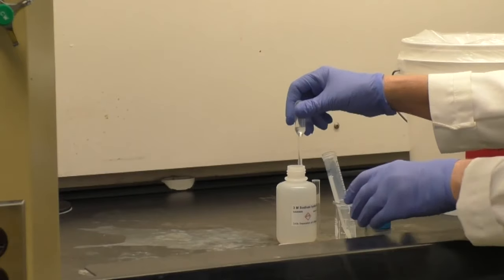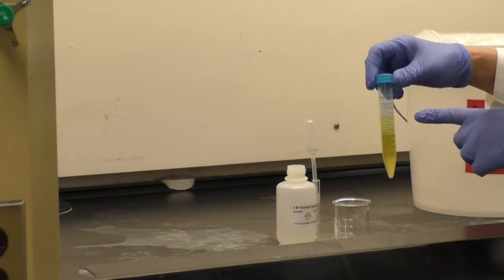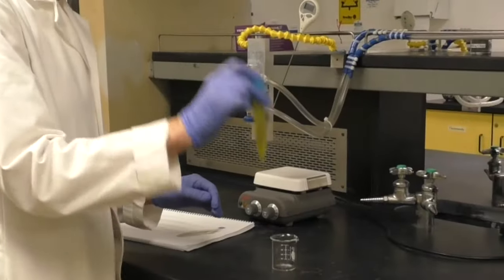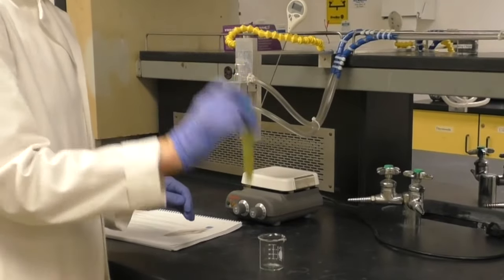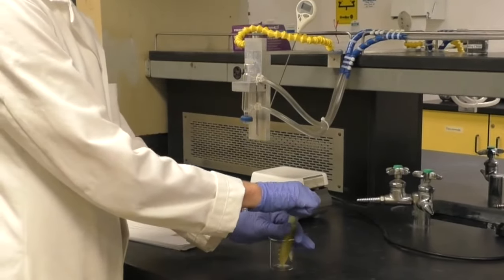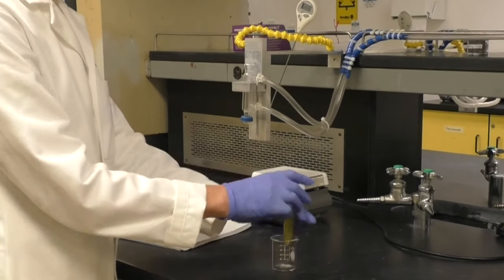Next, add 5 mL of 3 M sodium hydroxide. Cap the tube tightly and begin shaking for about 1 minute. Stop shaking occasionally and carefully remove the cap to release any pressure that may build up.